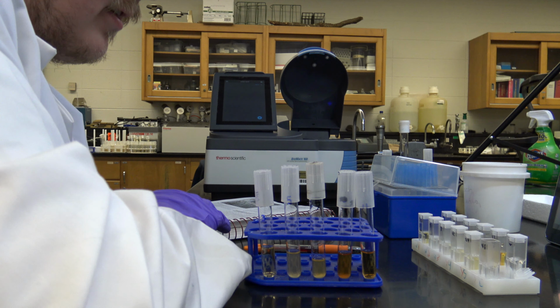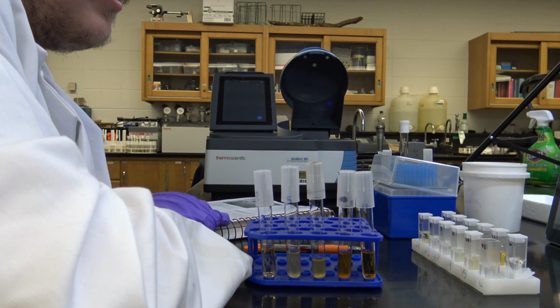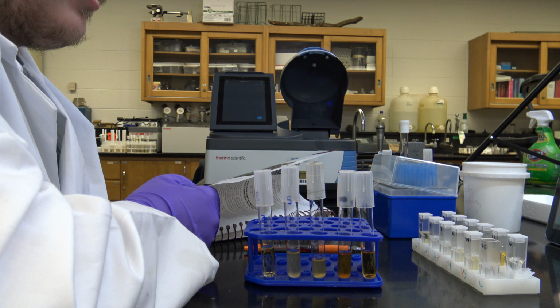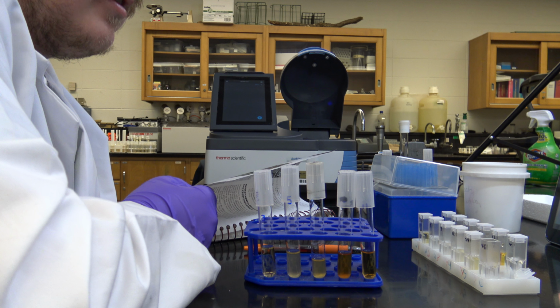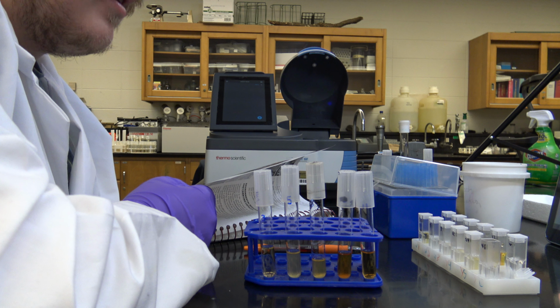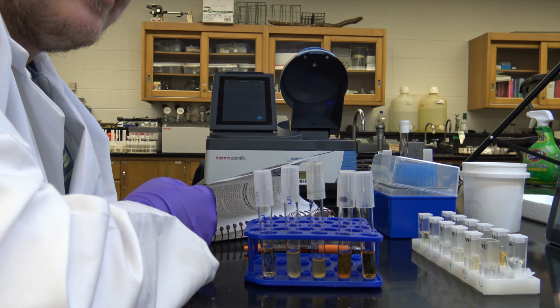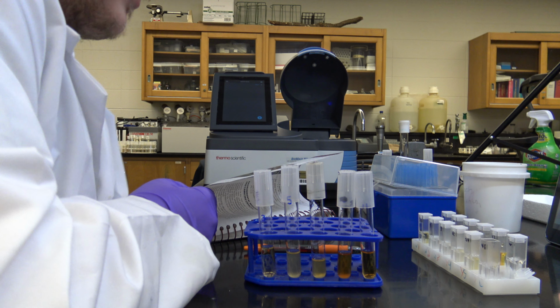Today we'll be doing the virtual lab for exercise 22 in your lab manual, looking at population growth, and specifically population growth in E. coli. We wanted to film this to show you the techniques and give you a visual of everything going on. This way too, you can get data, make conclusions, and analyze something to do with this lab.